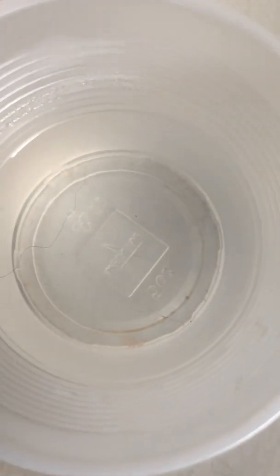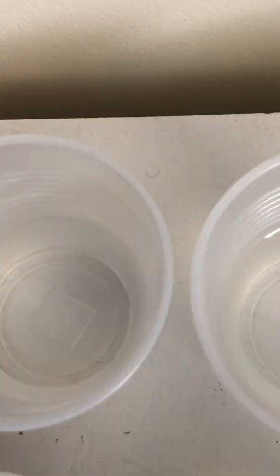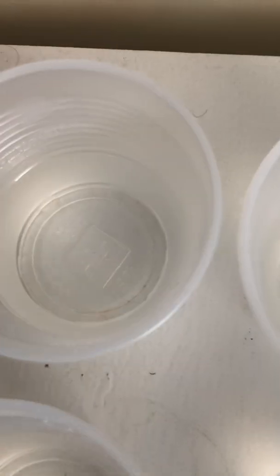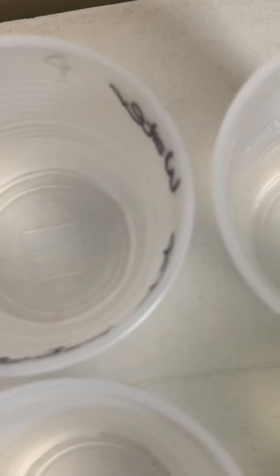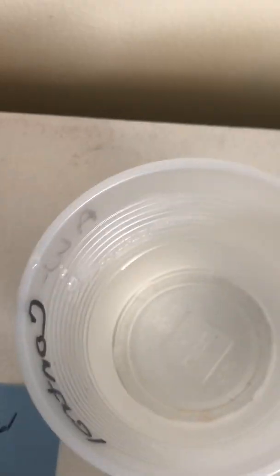The control will eliminate whatever we see in the control. If we do see it in the tap water, we can't say it's because of the addition of the manipulated variable, which would be the addition of phosphates. We could state that there's growth in the phosphate one, but because there's the same growth in the control, we cannot say that growth is due to the phosphates. That was probably going to grow regardless, is what we would conclude.